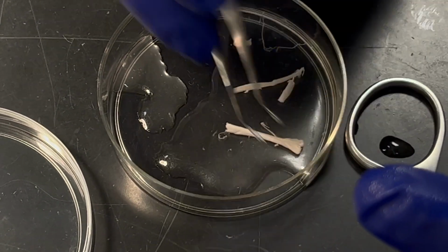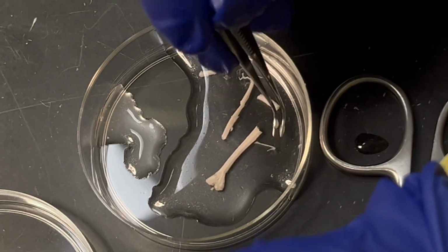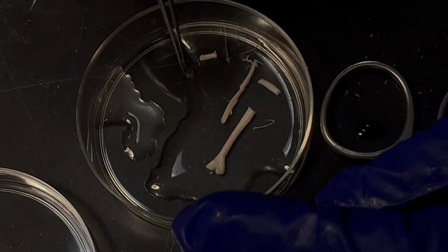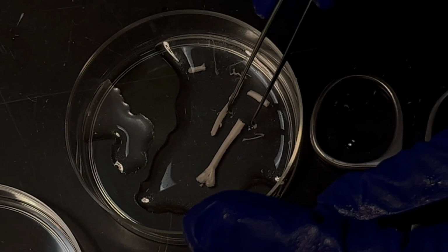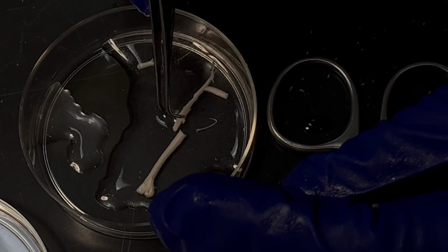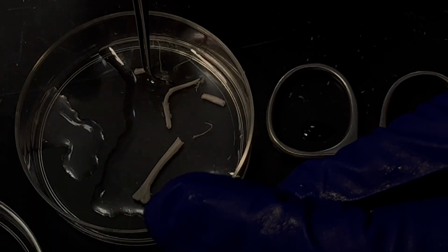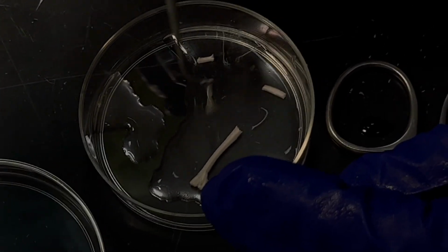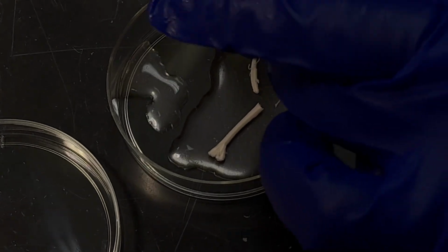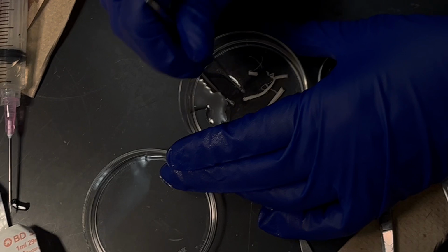Okay, so the way I do the collection is I always make sure I am doing rostral to caudal, and then do you see after this, it got a little bit fattened around this side, and if I could stitch it, that would be the lumbar part. What happened in reality is it broke from one side. But wouldn't it be a small piece? No. I can say words wrong, but what I'm trying to say is where the lumbar spinal cord would be, and this part is like sacral or cauda equina.